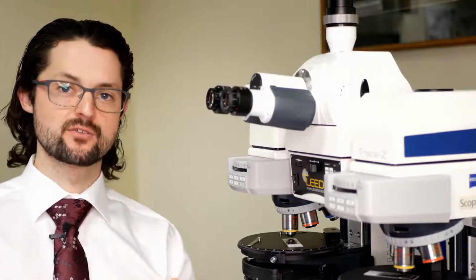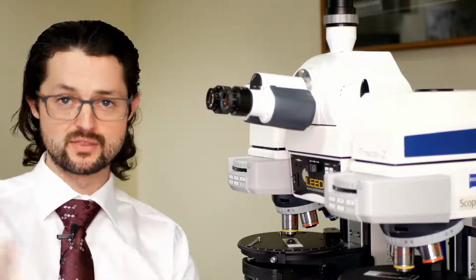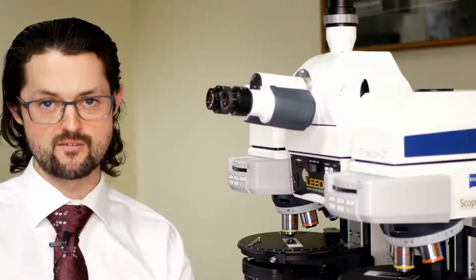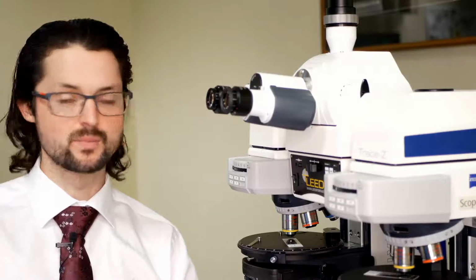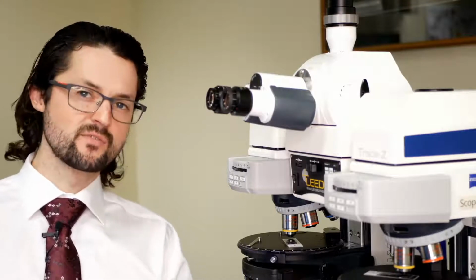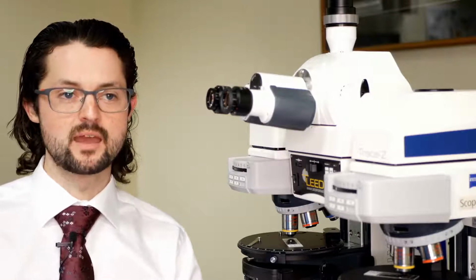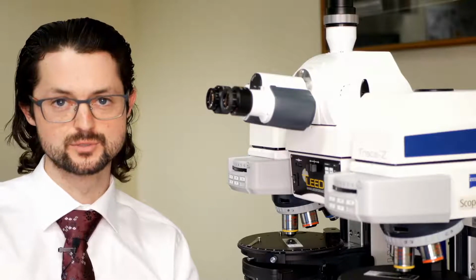Every week we put together a new training topic or new presentation topic that covers the breadth of our forensic microscopes. This week's particular topic is all about some options that we have for polarized light and reflected light Brightfield for our Trace Z comparison microscope as well as our LCT comparison microscope. Our video today is going to be kind of a short one. We're just going to do top level, what it is, how it works, and how it's relevant to labs that perhaps already have our comparison microscopes.